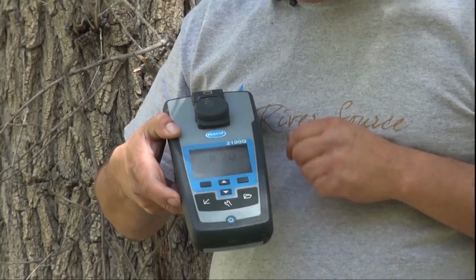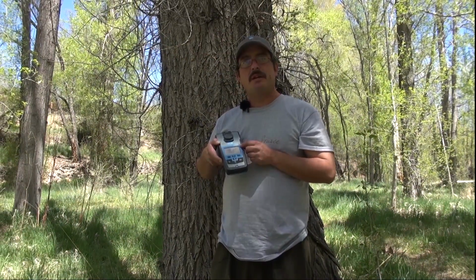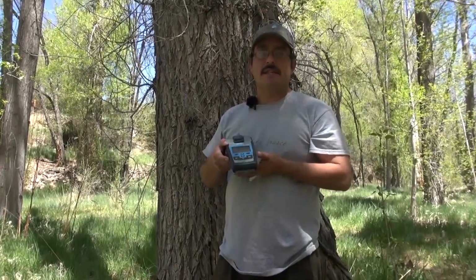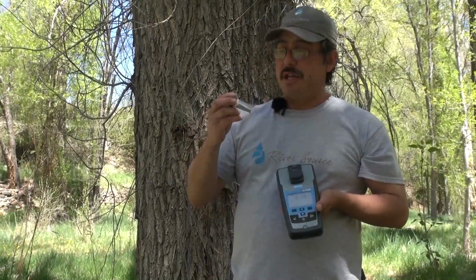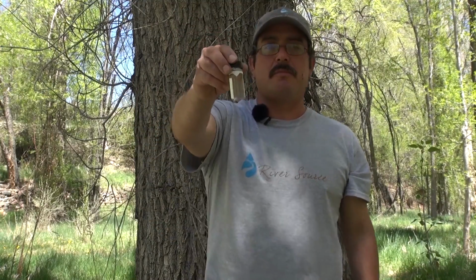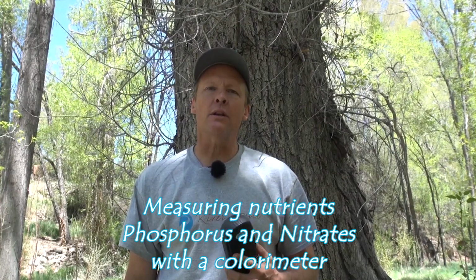Okay, and so the reading on the turbidity meter is 8.20, which is a really low reading for turbidity. The units for turbidity is NTU, which is called a nephelometric turbidity unit. Most important things to also consider is that we have a very good quality sample cell, that it is clean. We normally will clean our vials before and after every trip. Another thing is to make sure that there are no scratches or any oddities on the outside of the vial. And then I oftentimes will use my shirt in order to clean the vial to make sure that there's no fingerprints or mud.